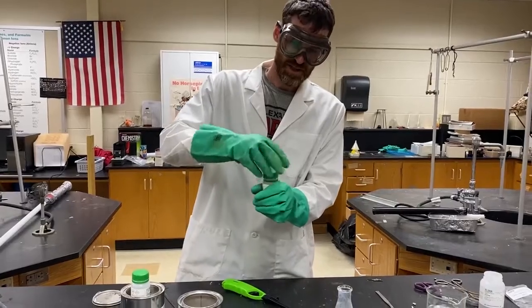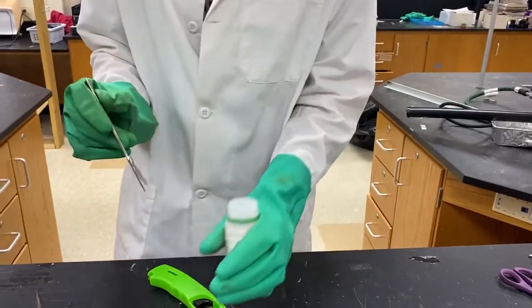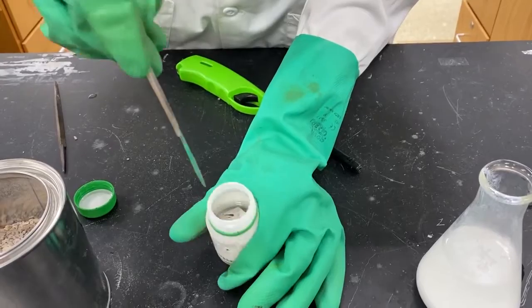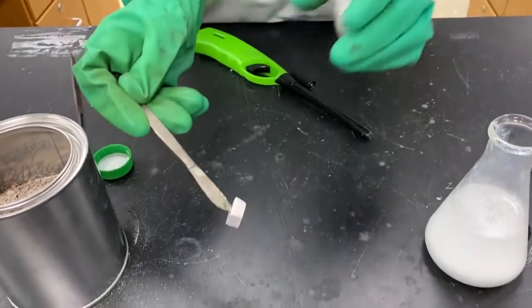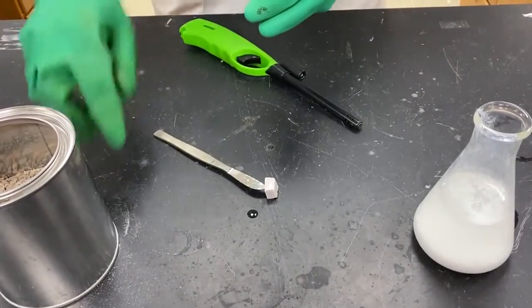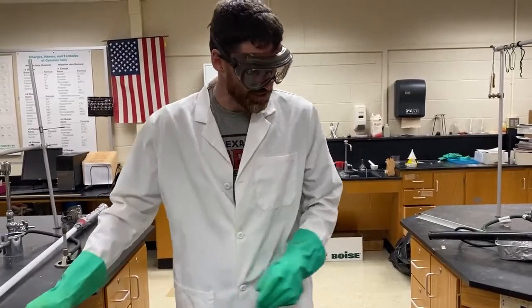Ooh, what liquid is this? Well, this is not water. If this was water, there would be no sodium left in here. But as you see, it's grayish, and I'm gonna stab it. Look at that. One of my dull scalpels, even rusting a little bit, and I stabbed the metal. I know it's not common, not ordinary to think of a metal as being soft, but this metal is soft.